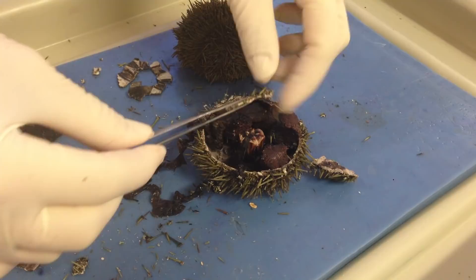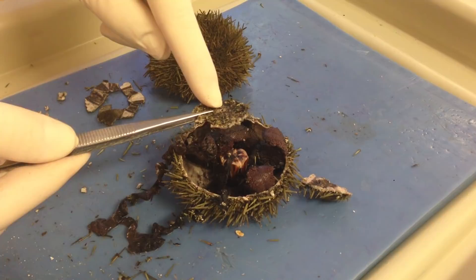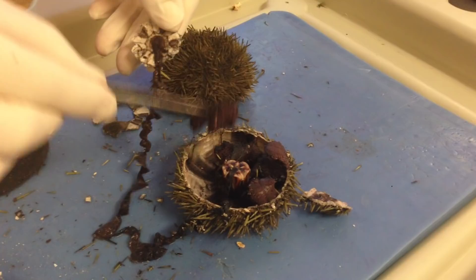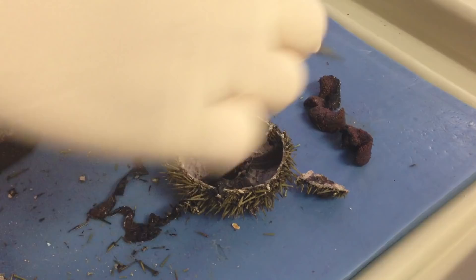As you pull this back, what you want to be able to notice is that this particular little structure right here is the stone canal, which is attached on the other side to the madreporite. A lot of times that breaks off, so you have to be careful. What you also have here is the anus or the rectum, which is going to empty out here. If we work backwards, we can pull out all the gonads, and then you can see the insides where I pulled out this long intestinal tract.